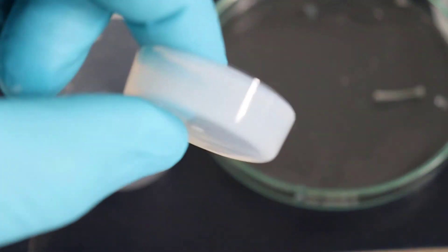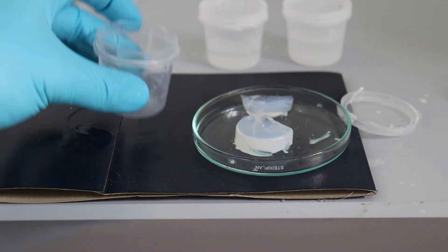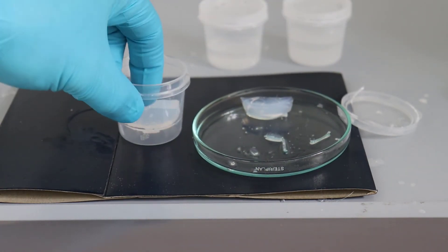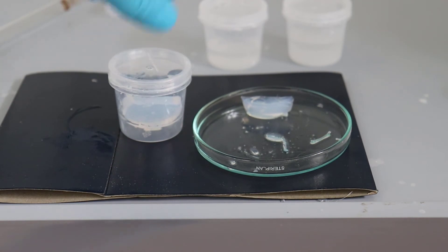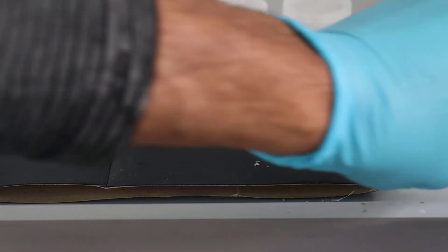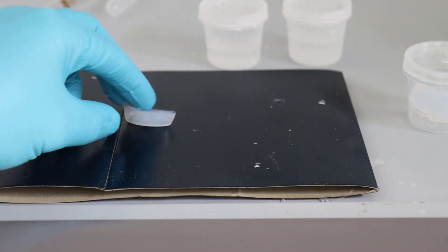So there it is. It's quite thick, reasonably hard, and reasonably stable. This particular one has only about 50% pores so it's comparatively hard. You can make them with more pore volume if you want. I'm going to take this piece that I've cut off and dry it for demonstration purposes to show you that the tension inside it will cause it to crack.